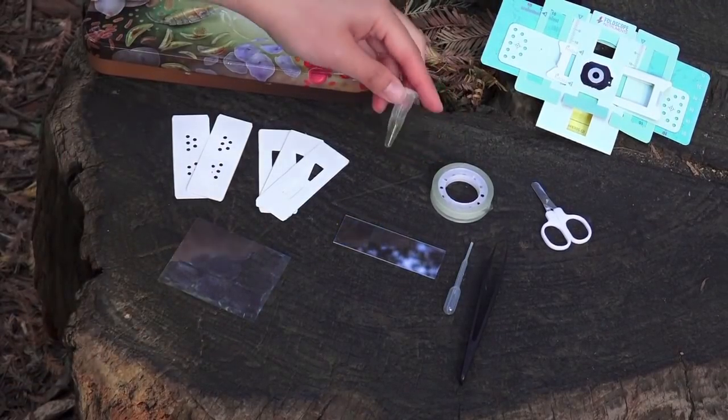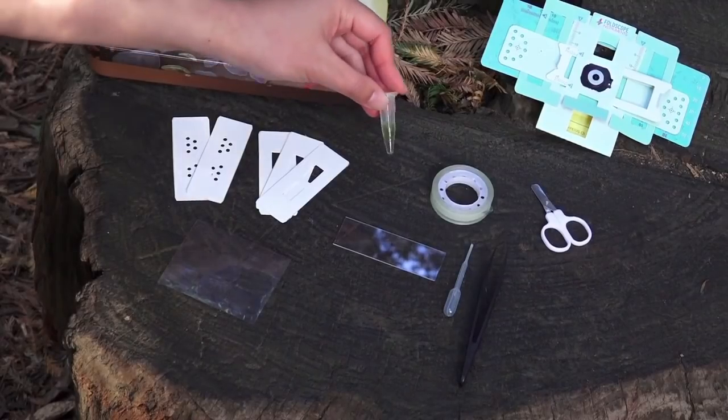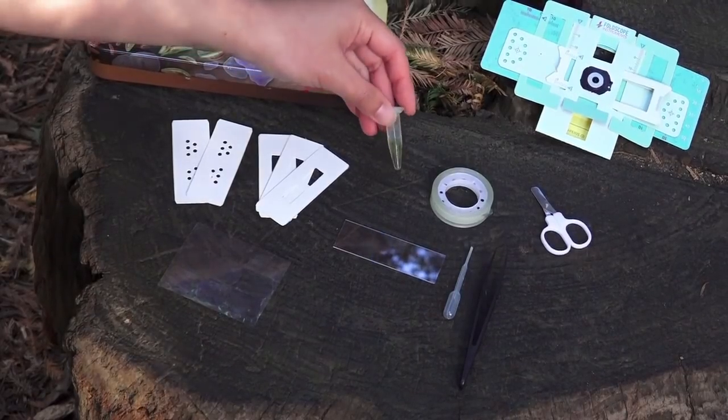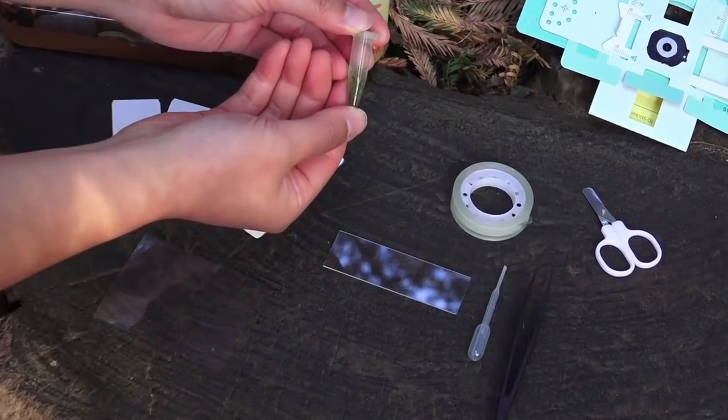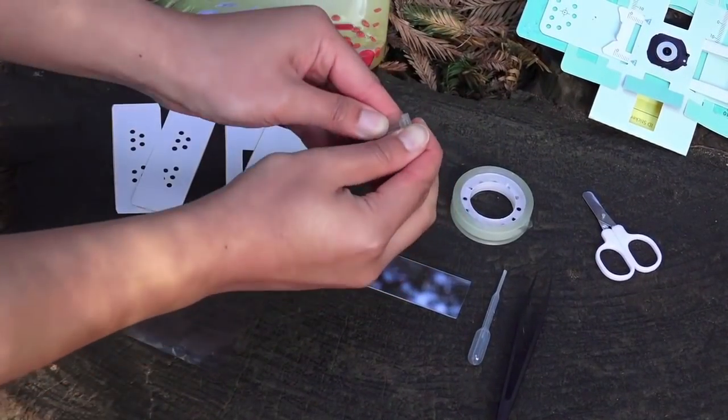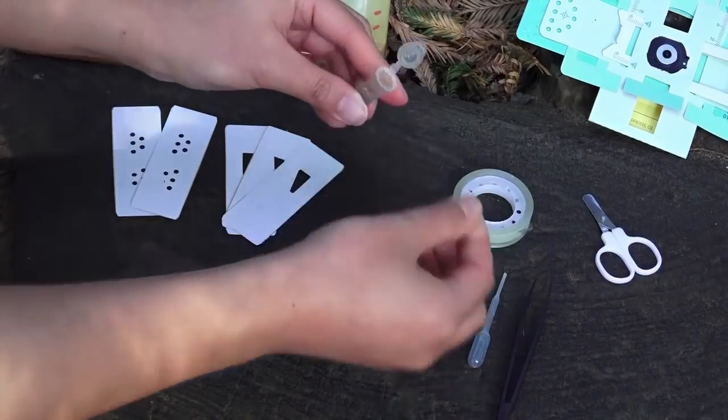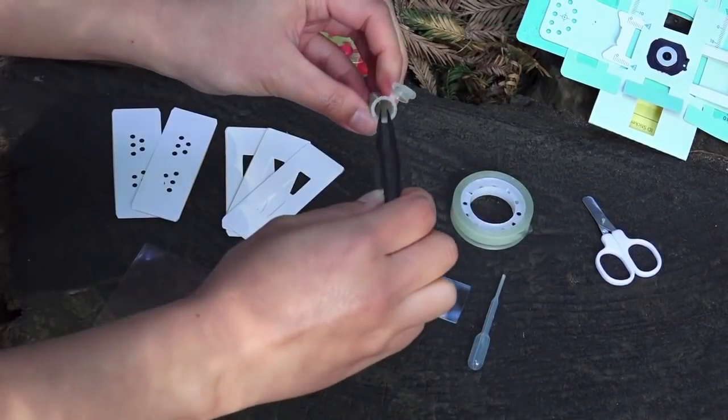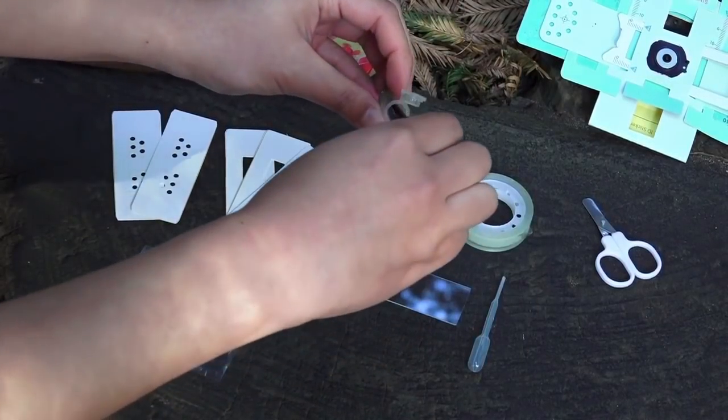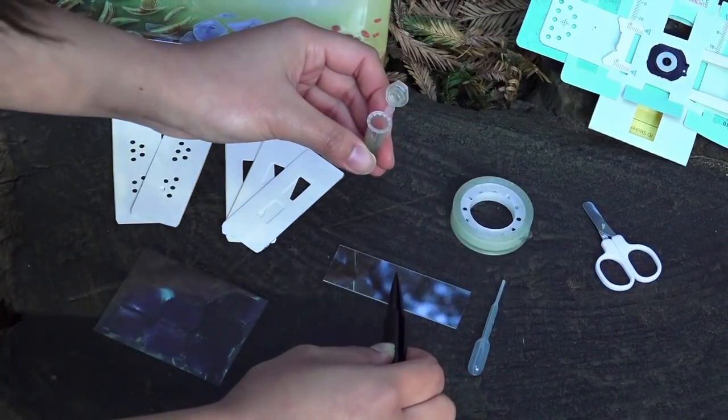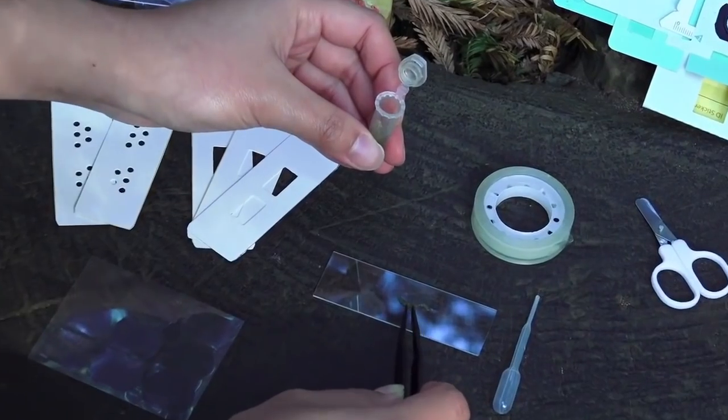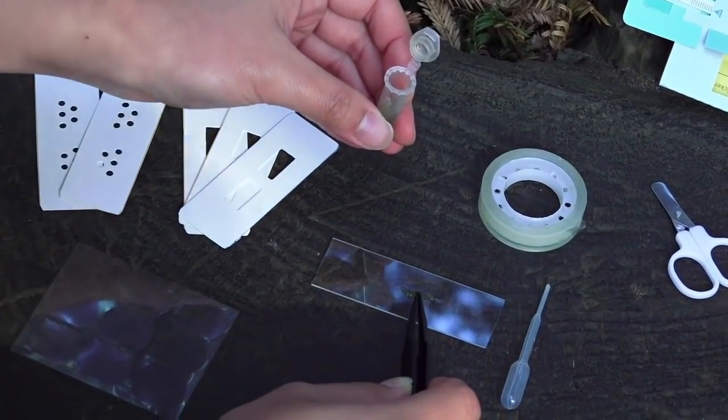I have here some water and algae sample that I took when I was going out with my friends at a picnic. So let me just take a little bit of sample here. Just place it on top of the glass slide.